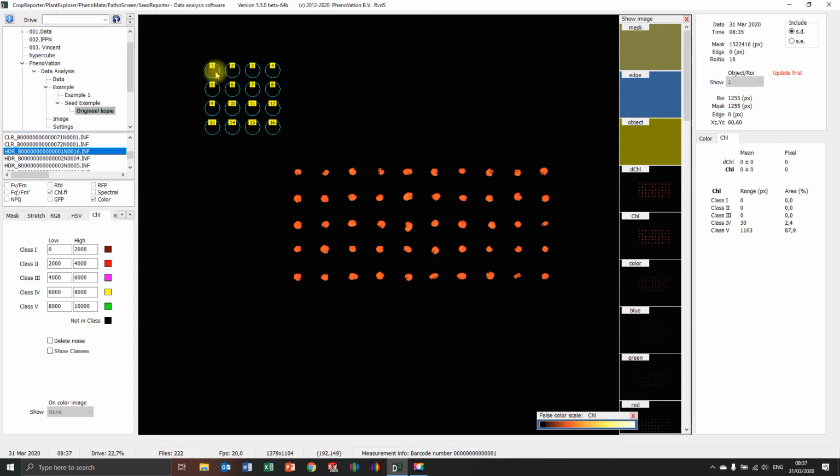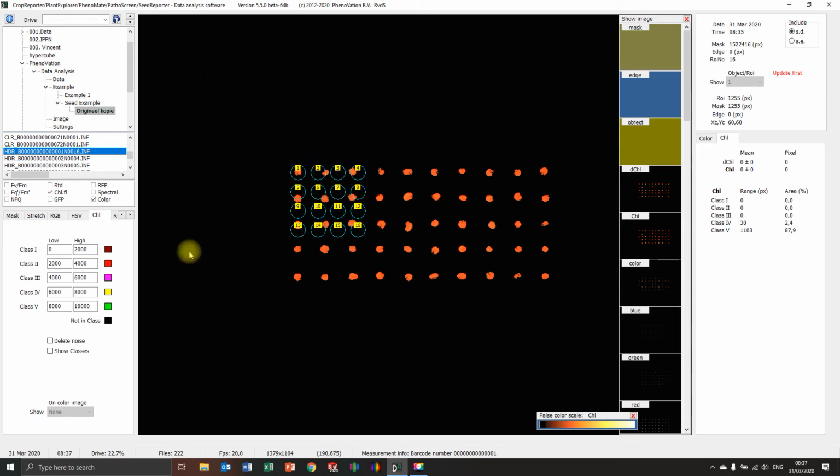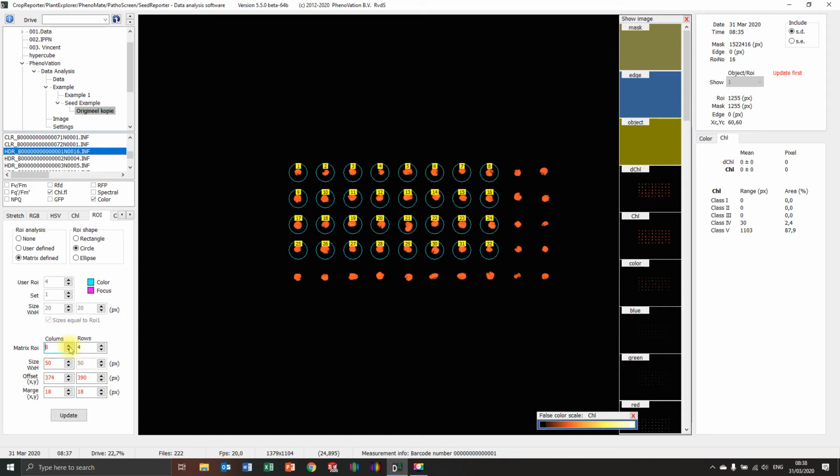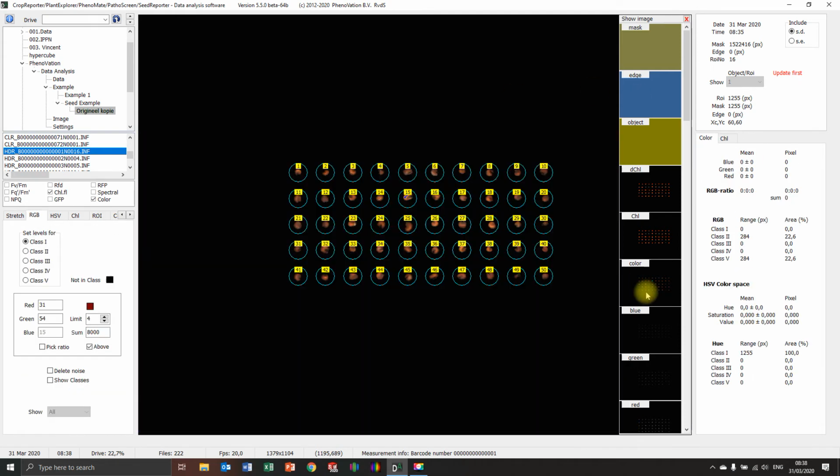If you drag the first one, you drag this. If you drag the second one, nothing happens. You always drag the first one, put it on top of it, and then you are going to use the size first. I'm going to put it on 50. So 50, put this one in the middle. And then I'm going to use the margins, so the XY margins, you can see now it shifts like that. This is pretty good. 18, so probably also 18-ish that way. And then I'm going to increase the rows. 1, 2, 3. There you have it. And one extra. Now you can see I perfectly have 50 regions of interest on every individual seed.